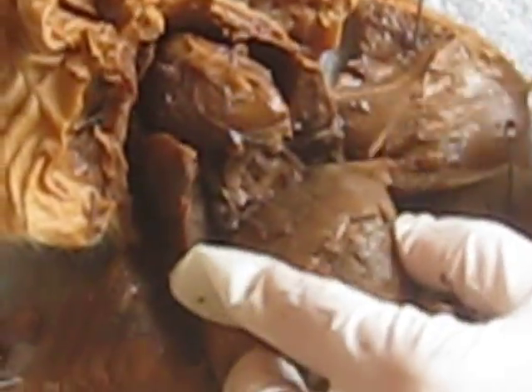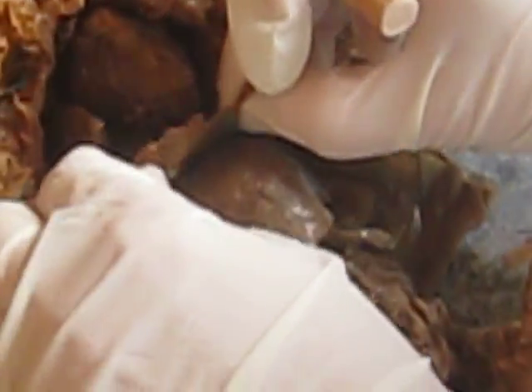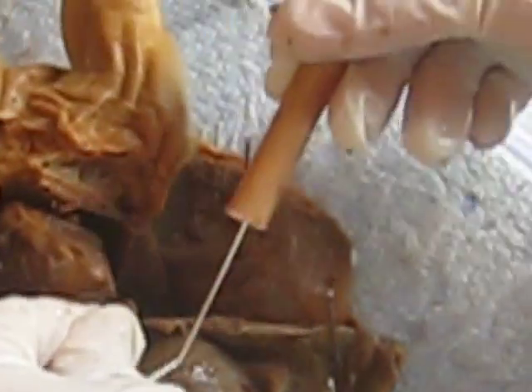So now, still moving inferiorly, oh, by the way, the lungs are encased in the pleural cavity. And this right here is muscular tissue, is the diaphragm, and it separates the thoracic cavity from the abdominal or the peritoneal cavity. So this is the peritoneal cavity, and this membrane right here is the peritoneum.